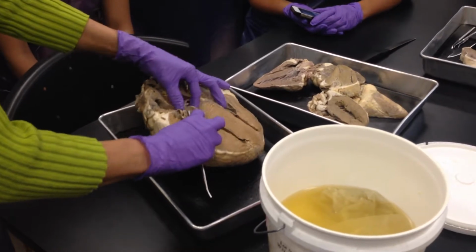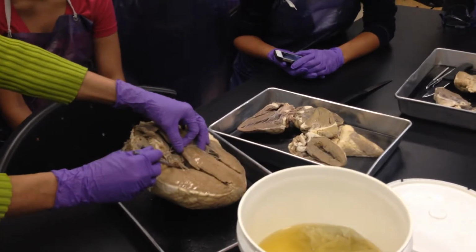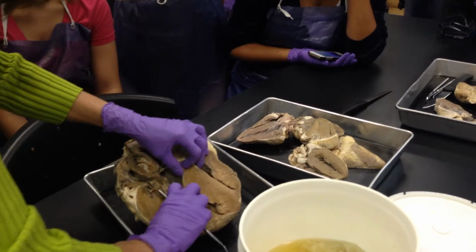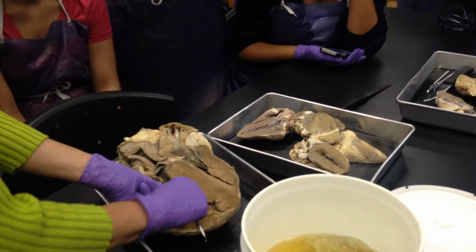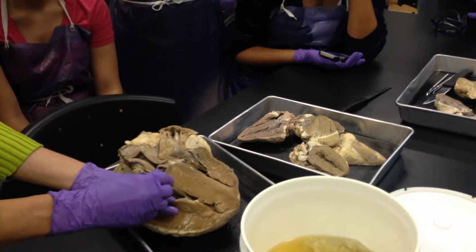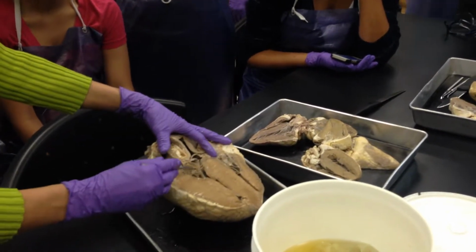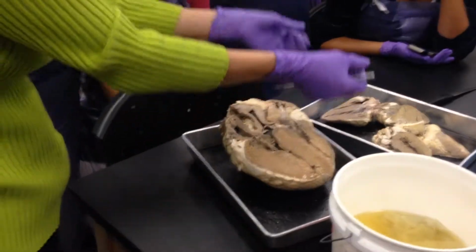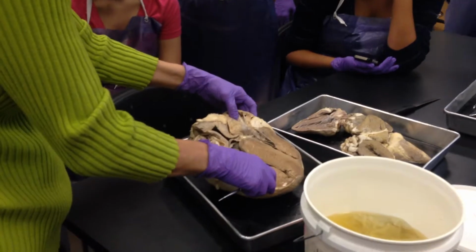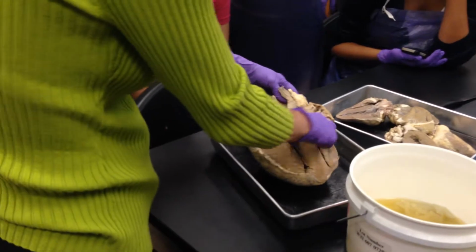Atrioventricular valves have these cusps here, and then what did we call these strings right here? Good, Raphael. Chordae tendineae. And remember, the chordae tendineae are attached to these nipple-shaped bumps. Papillary muscles. The chordae tendineae are just these cords or strings that keep the valves from going back in the opposite direction, so they help prevent the reverse flow of blood. Like a tendon, holding it down, tethering it there.